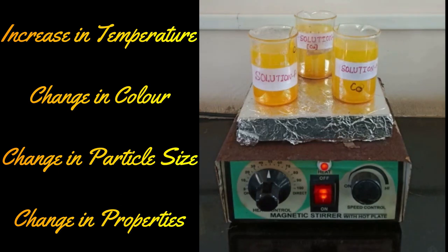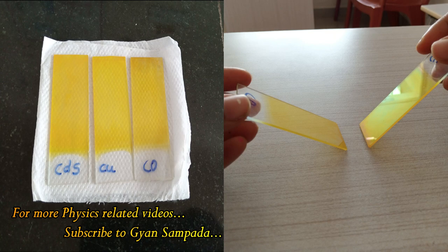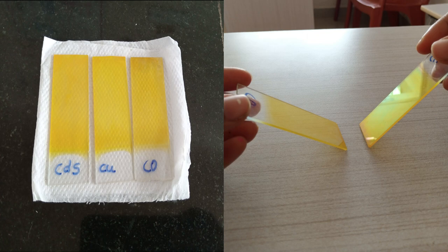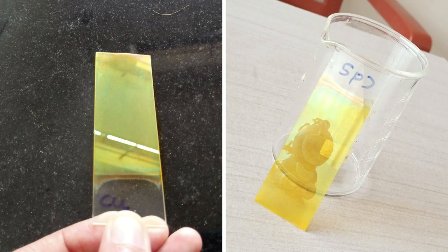After the reaction, the glass slide was removed and washed thoroughly and dried up. We can observe how uniformly the deposition has taken place and even it is transparent and highly reflective.